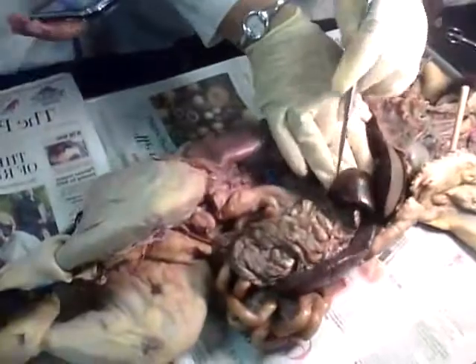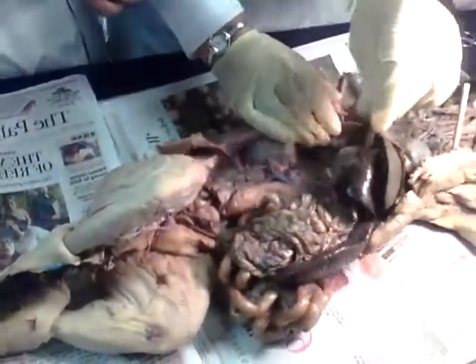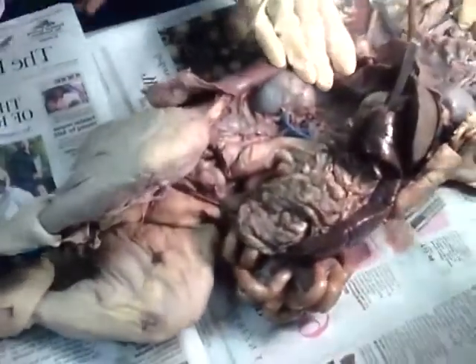Don't put on the cat juice. Miss, you're sticking stuff too hard.